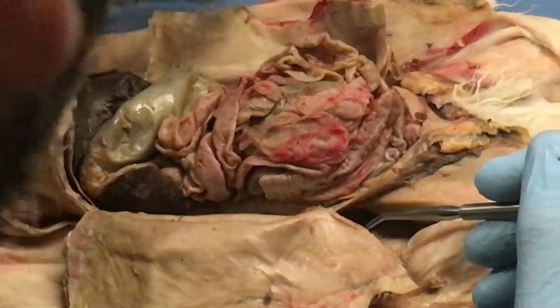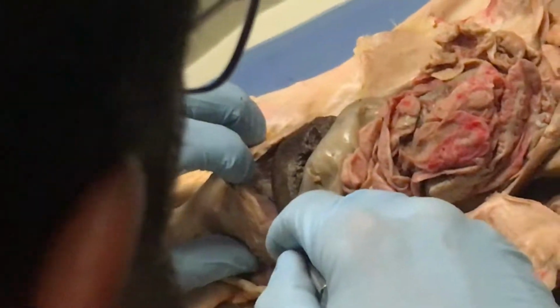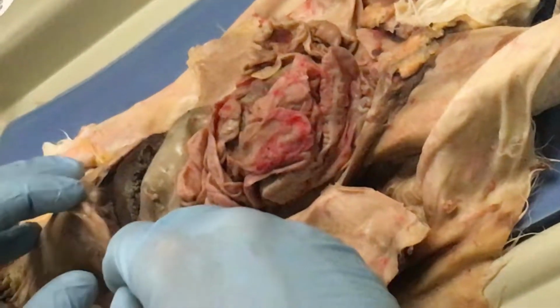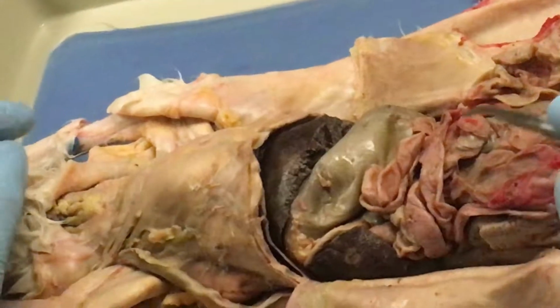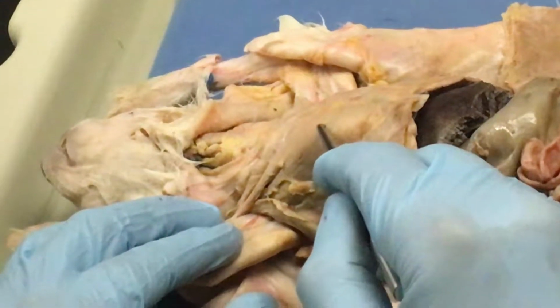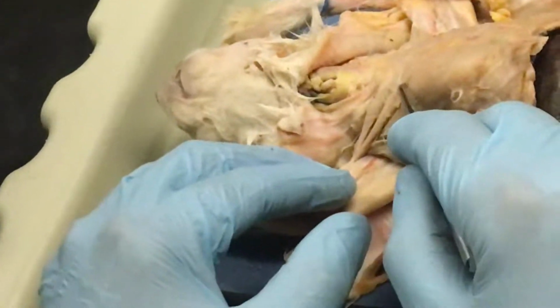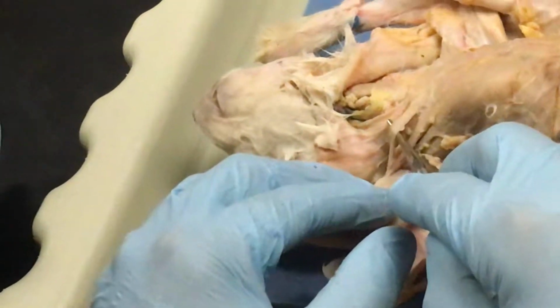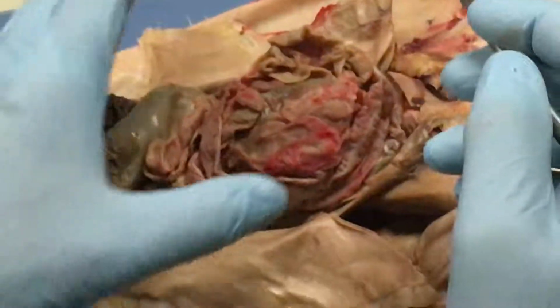Okay. Diaphragm is this muscle up here on top of the liver. That's the diaphragm. Okay. The linea alba, don't worry about it. That's the white line in between the two rectus abdominis muscles. We're not going to worry about that. Xiphihumeralis is right here. Pectoralis profundus right here, pectoralis superficialis descendens right here, pectoralis superficialis transversus right here. Okay? So those are the muscles that you need to know.